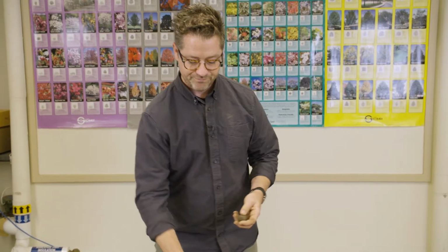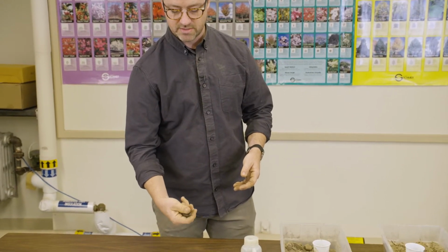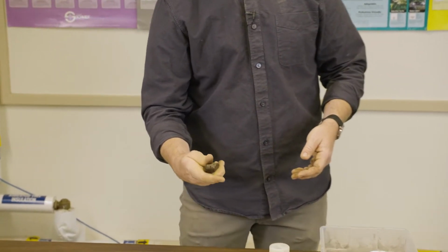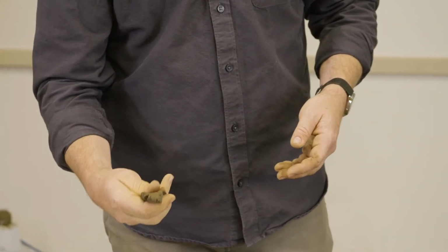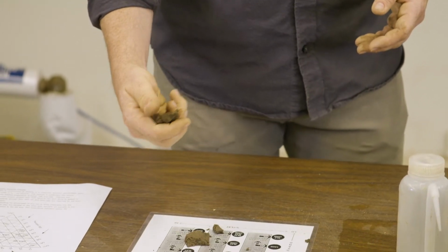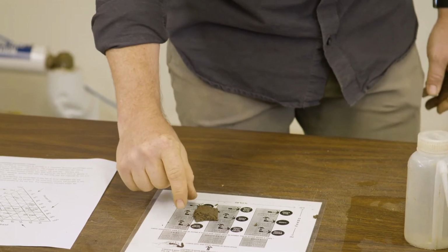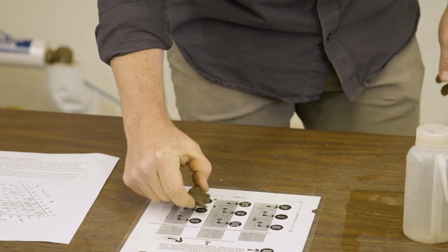Okay, so the next part of this test is to try to form a ribbon. The ability of the soil sample to form a ribbon and hold it is going to be a measure of the percentage of clay. To form a ribbon, you take the sample in the palm of your hand like this, and you start to squeeze and feed it out. You want it to break naturally and fall to the table. There it goes. You do that a couple times, each time estimating the length. So here we have about three-quarters of an inch.